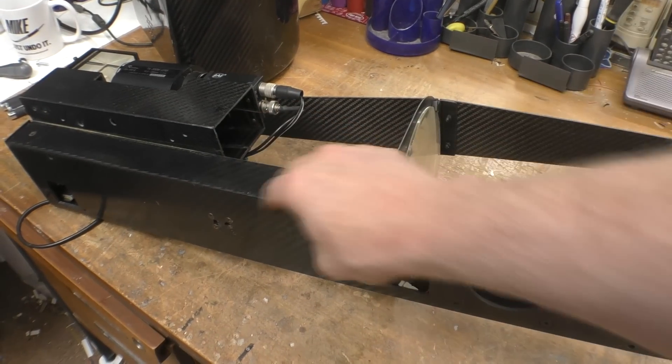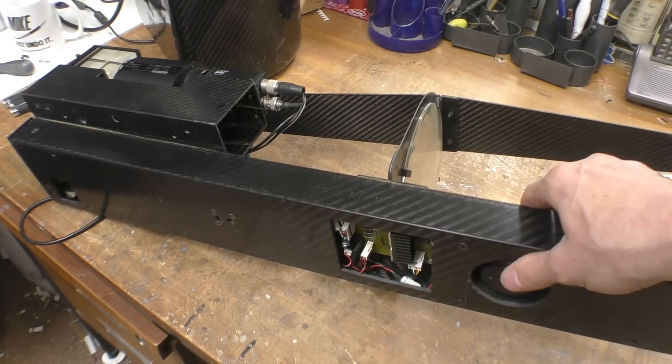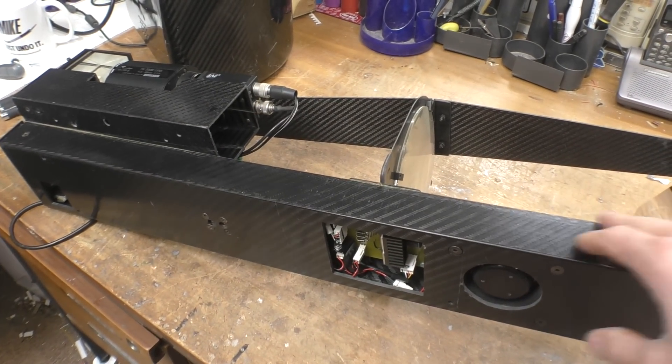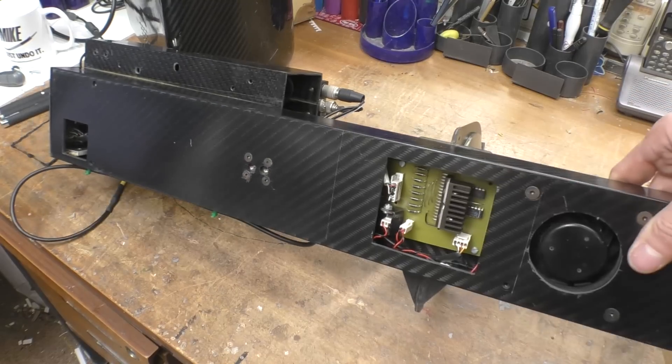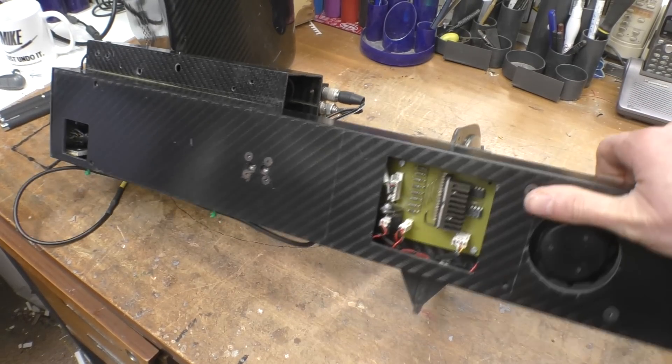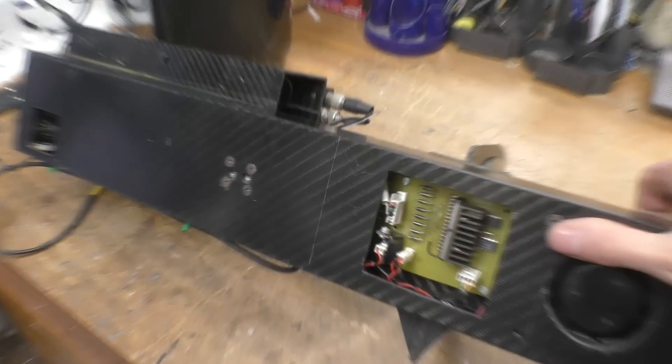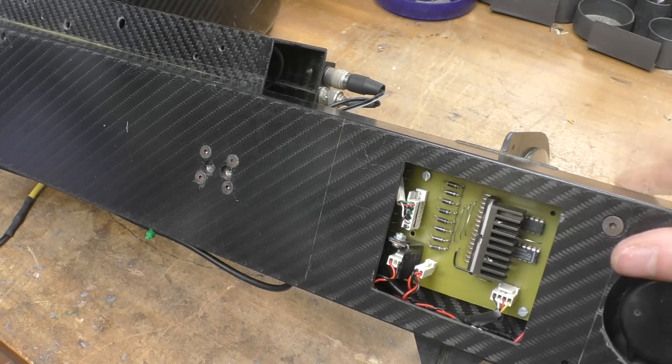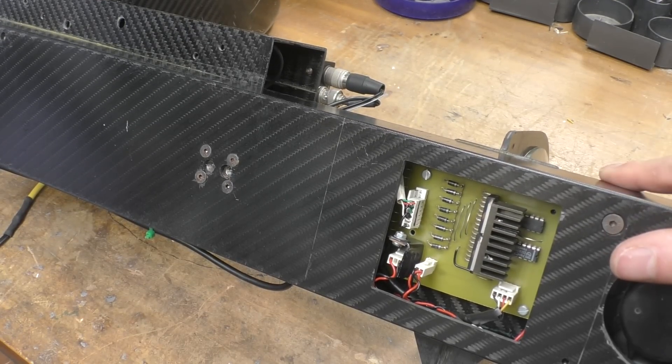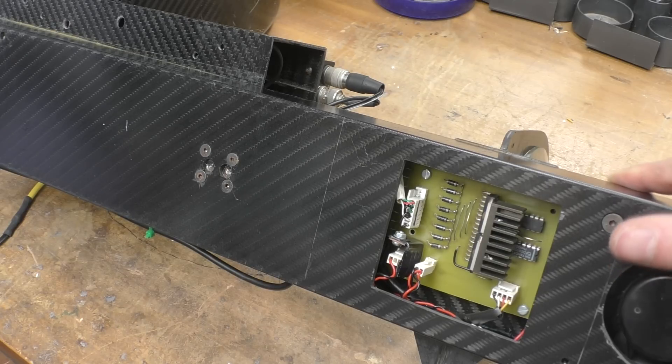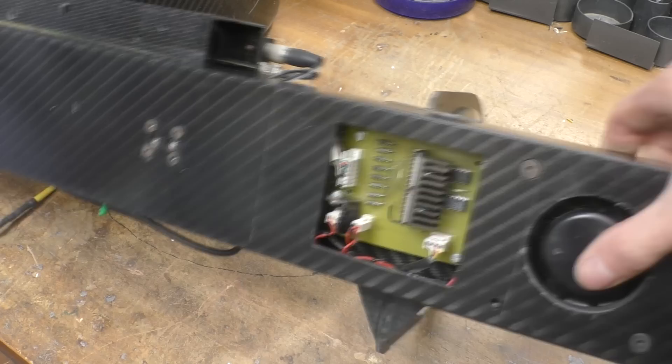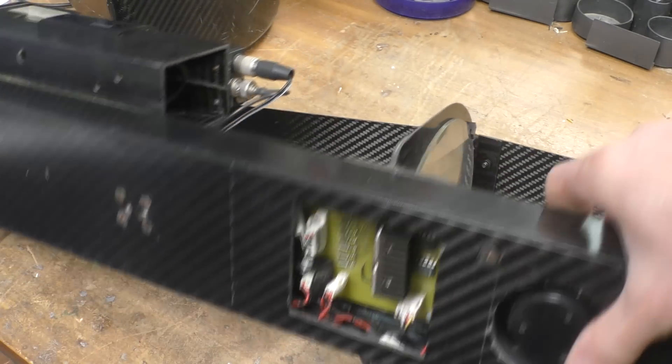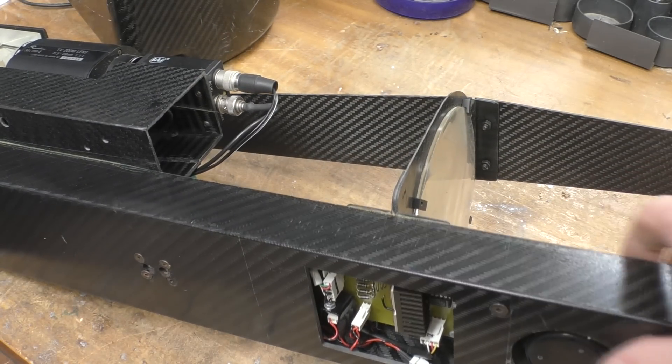This seems to be constructed around this carbon fiber box section which is extremely rigid. There's a little bit of control circuitry here. This looks like a rather handmade PCB. I think this is going to control the motors in the motorized zoom lens on the camera. There's a fan here which blows air down here, which I think is primarily for cooling the laser.